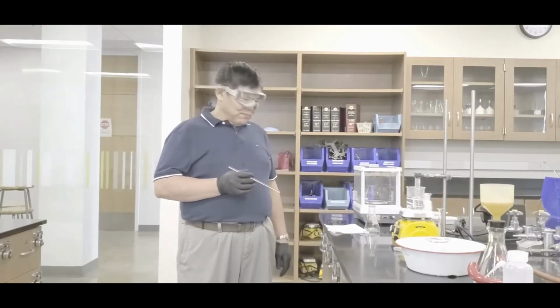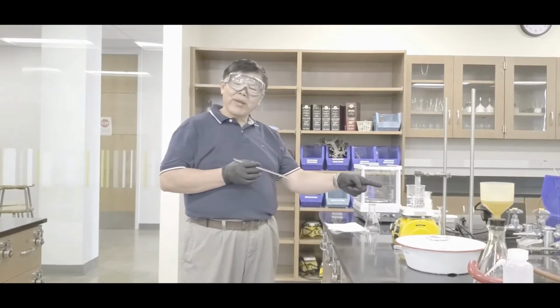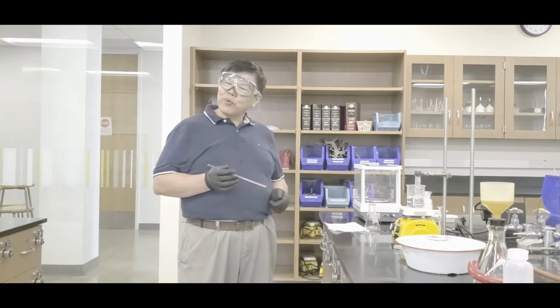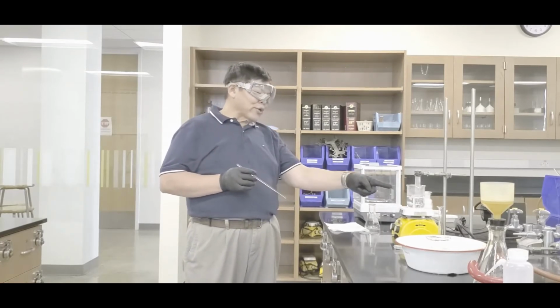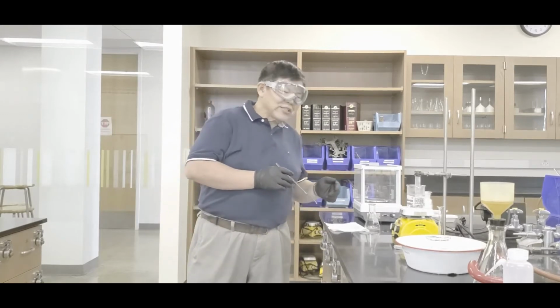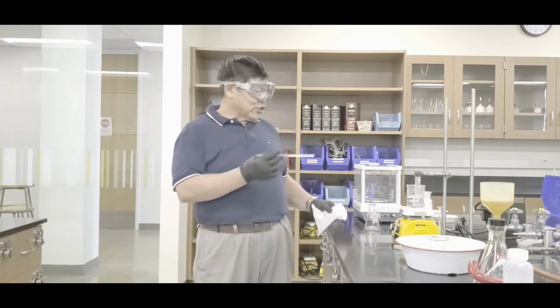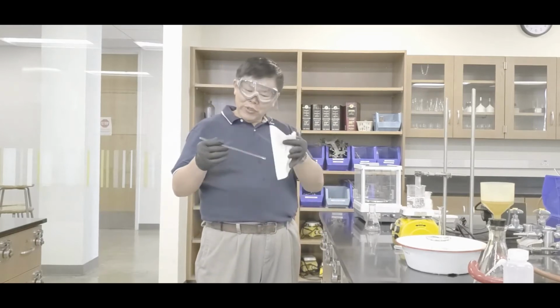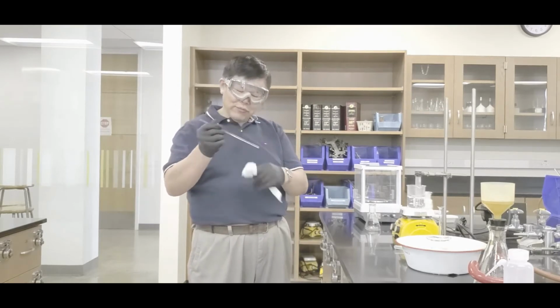All right, class. Looks like we waited a bit, and right now it's boiling. It has been boiling, and you're supposed to cook this for about 10 minutes or so. What I did was that this has been cooking for about, say, 5 minutes or so. Now, if it's clear, then perfect, yeah? But if not, what you do is stir, yeah? But hey, guys, make sure that the stirring rod is dry before you put it in there, okay?